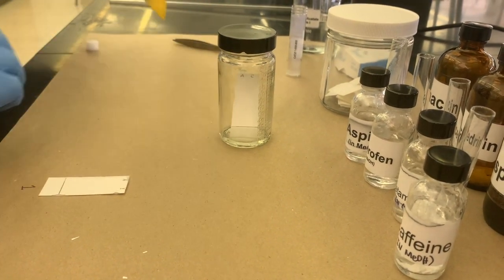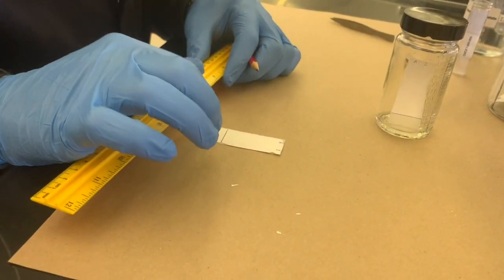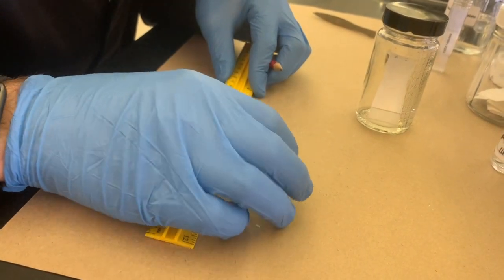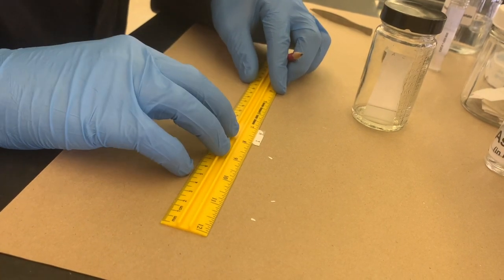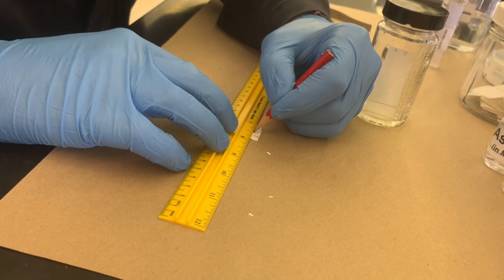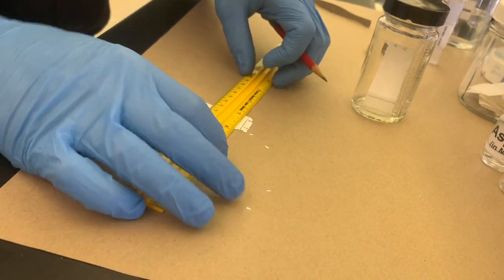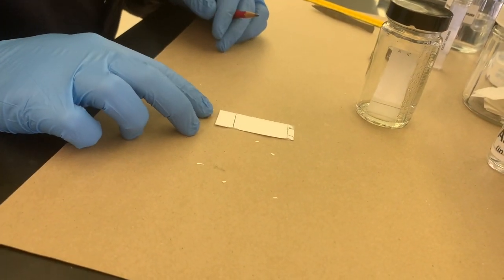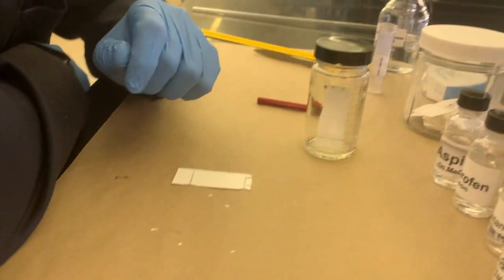So now, you might not always remember where the solvent front ended on your plates. I remember that it ended just right before the A and the I, but in general, you should always try to label it as soon as the plate comes out of the TLC chamber. That's where the solvent ended. This will help us calculate the RF, or retention factor, later on. And now, we wait.